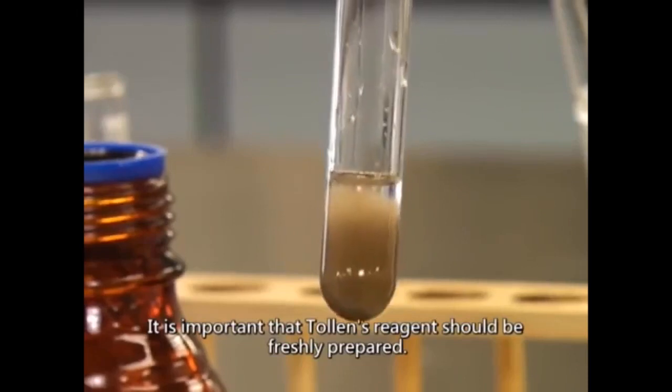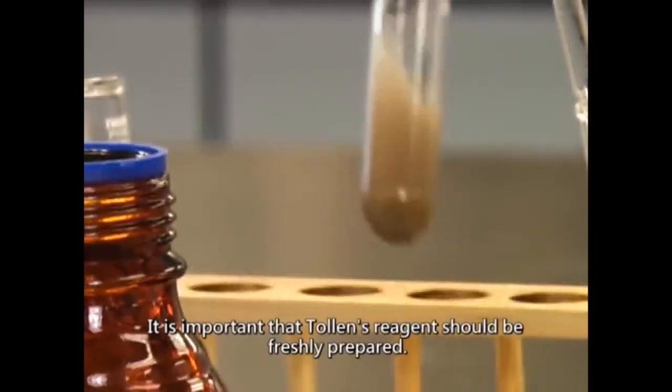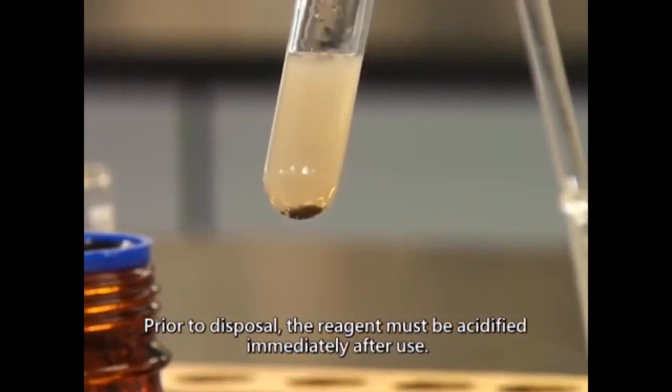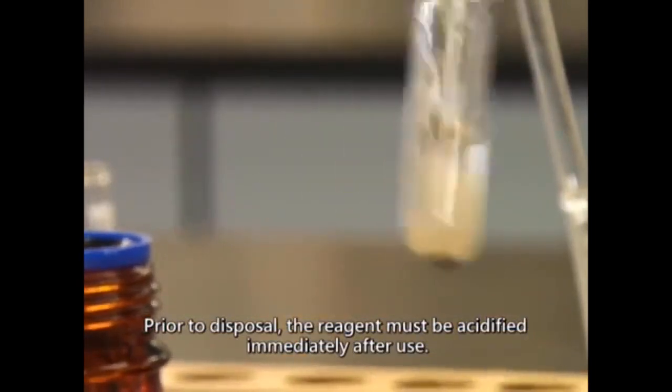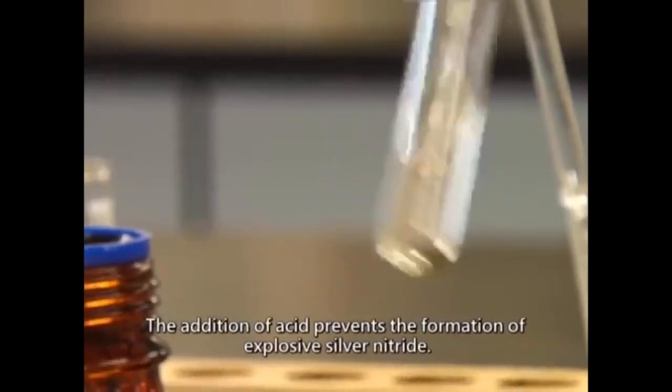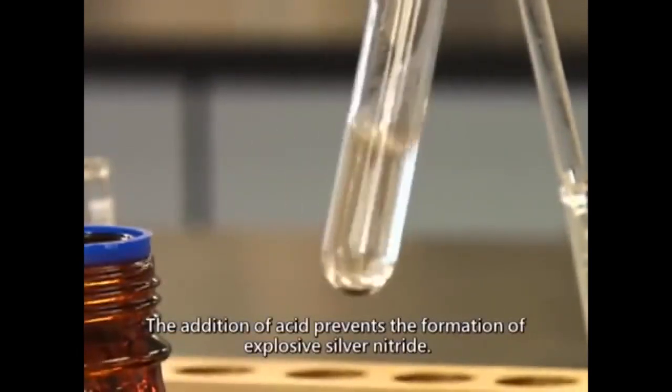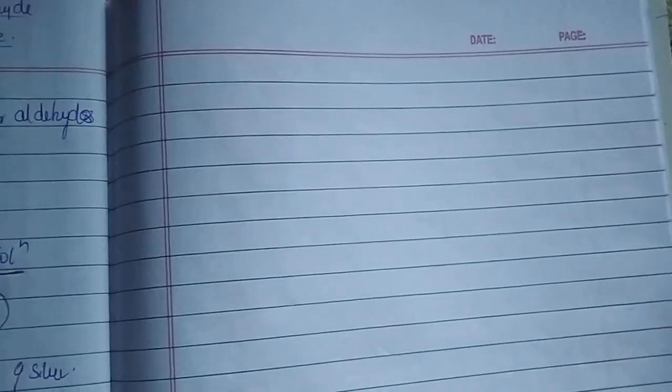It is important that Tollen's reagent should be freshly prepared. Prior to disposal, the reagent must be acidified immediately after use. The addition of acid prevents the formation of explosive silver nitride.